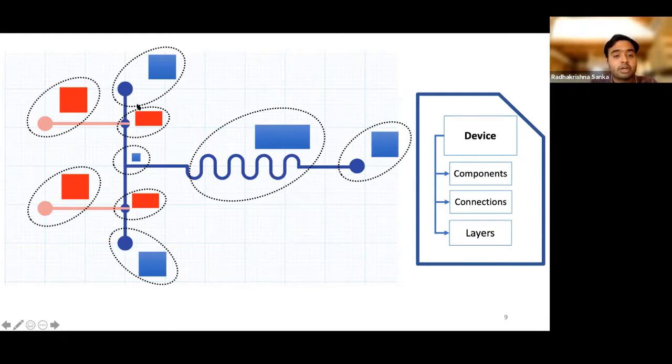So let's say we wanted to know what happens to the fluid being injected from this starting port. Because we treat this like a graph of components and connections, we actually know how every component is connected to each other, and based on the valve state, how the fluid will flow through. That is something you can't figure out using AutoCAD. And when you're trying to build large designs, having this ability is going to make life a lot easier.